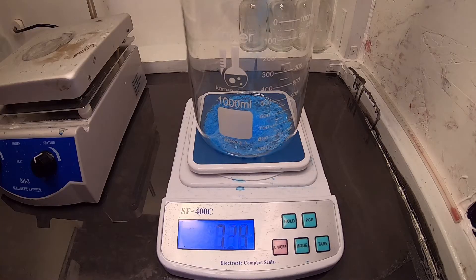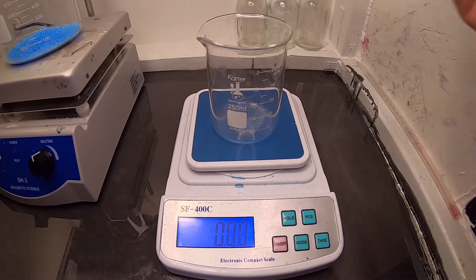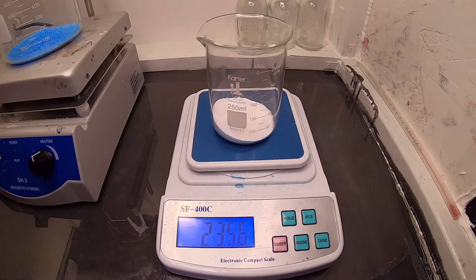Let's get on with the chemistry. First, I weigh out 50 grams of copper sulfate. Next, 24 grams of sodium carbonate.